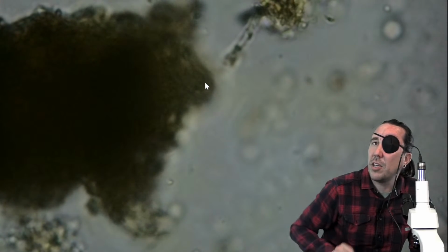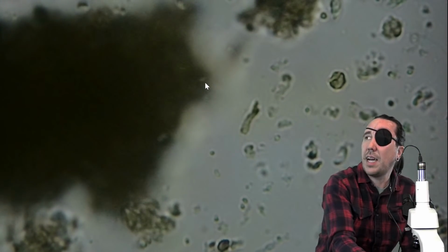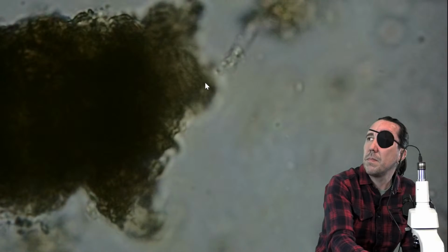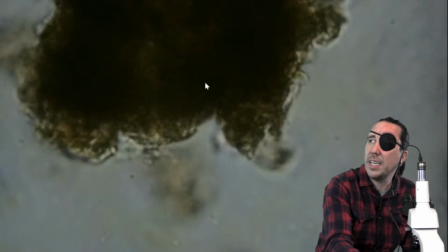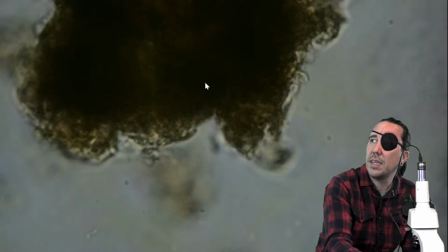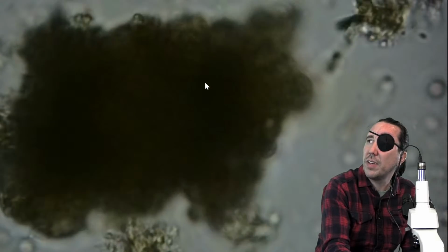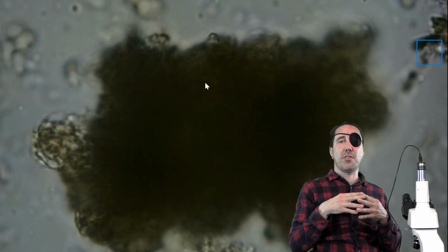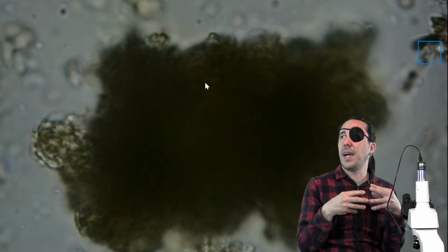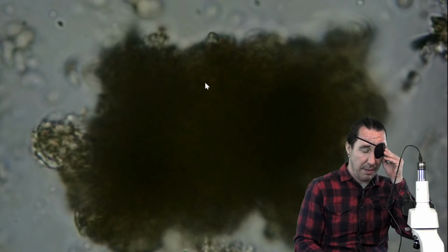Here, that big thing, that's going to be humic acid in that aggregate. You've got this dark coloring on the entire left-hand side of the screen. One giant aggregate. It's got humic acid in it. It's hard to see organisms when it comes to these big aggregates, but it pays to stop and check them out, because when you've got fungal hyphae going through soil or compost, they're attaching themselves to the organic matter to decompose it. So with that in mind, they're likely going to be really connected to aggregates and bits that you have in your sample.